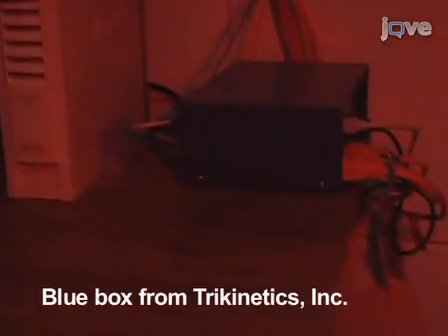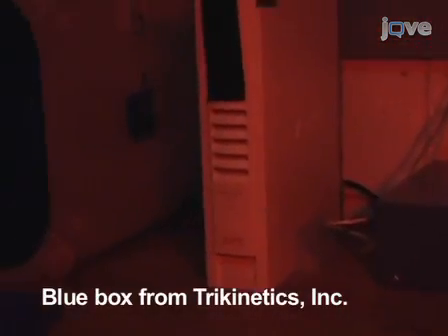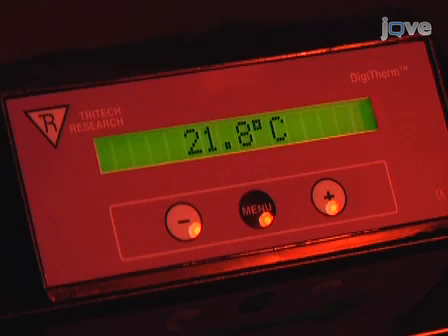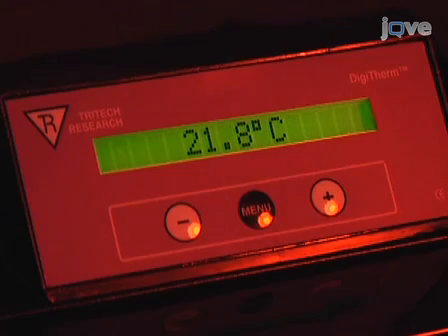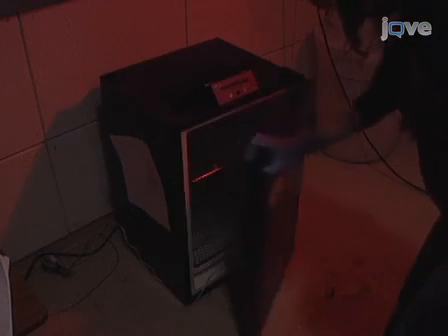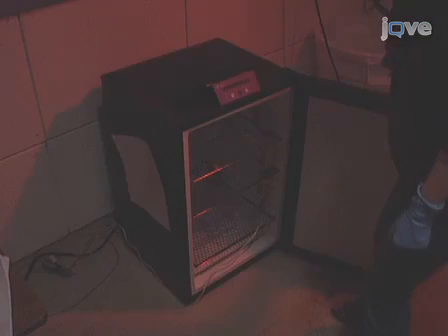Connect the monitoring devices inside the incubators to the computer via a power supply interface unit, which serves to power the activity monitor via the telephone line. Finally, mask possible light sources from LEDs of electronic devices or an improperly sealed incubator door with duct tape or black cloth to ensure free-running rhythms are measured in the absence of unwanted light.